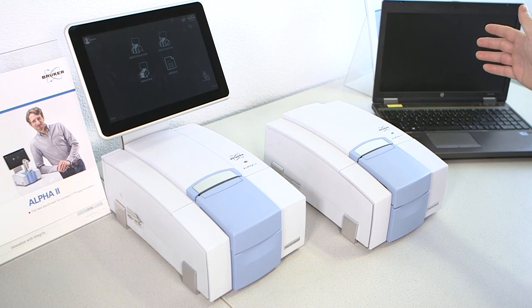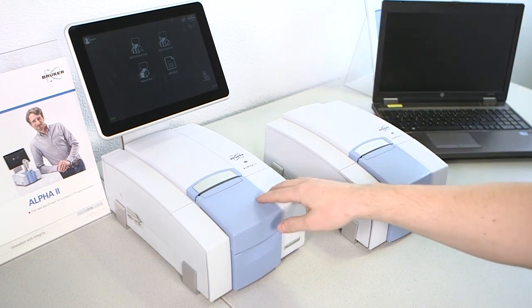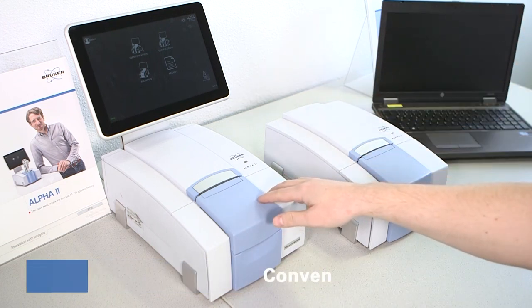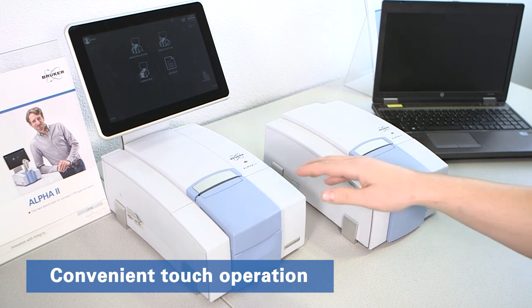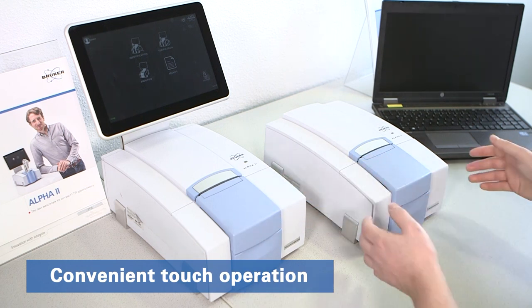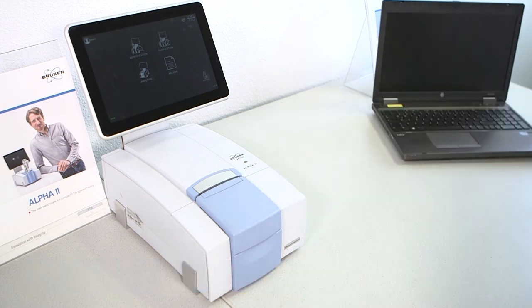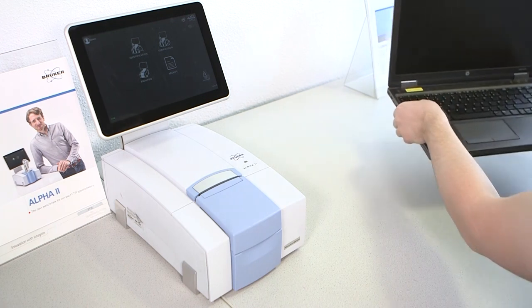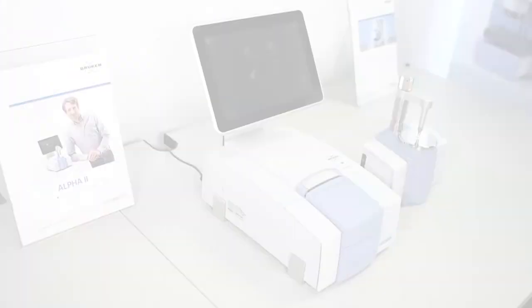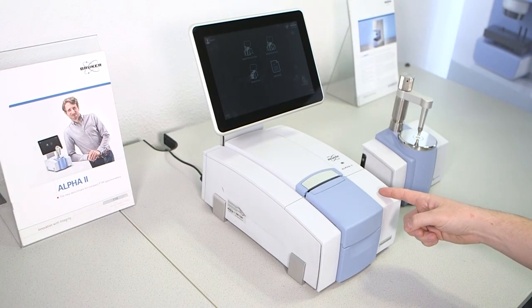More recently, however, touchscreen operation was introduced and has since revolutionized the user experience in infrared spectroscopy. For this series of educational FTIR videos, we are using an Alpha 2 operated by Opus Touch.